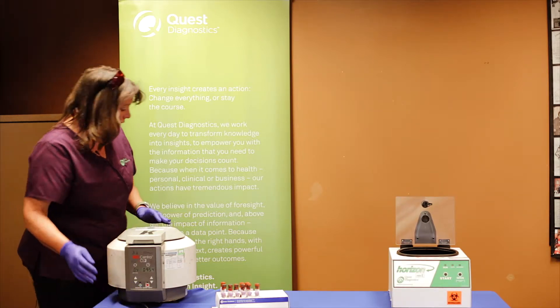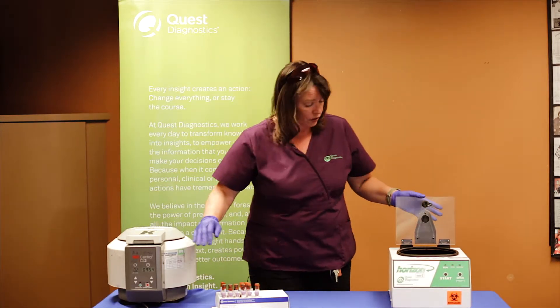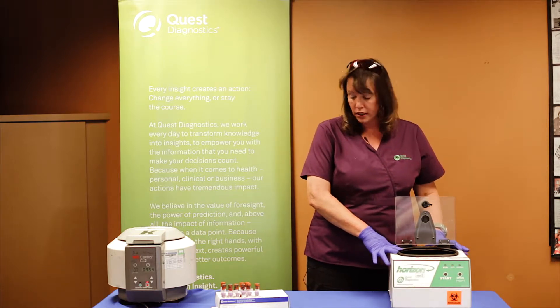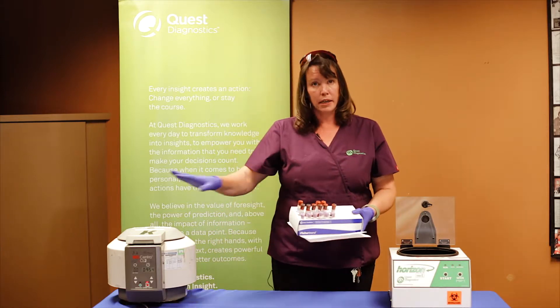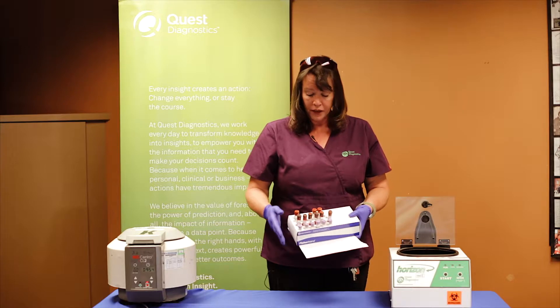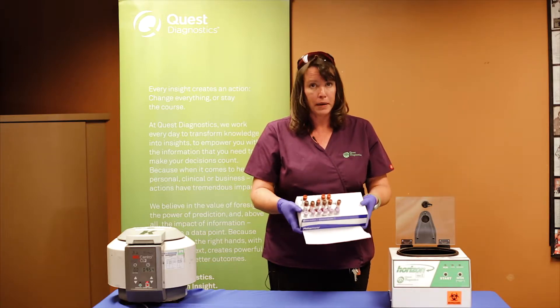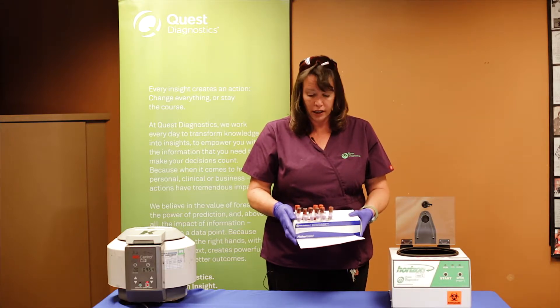The other centrifuge we have out here today is what is called our six-cup centrifuge. This one only holds six samples at a time. When you are at a health fair, you are going to get a box — hopefully from a sorting table off to the side. You will be getting a box with samples in it that should look like this, with paperwork that should have already been checked and confirmed to be in order.